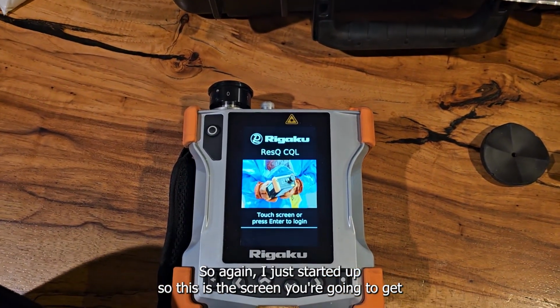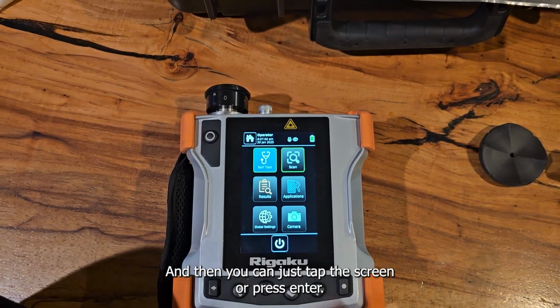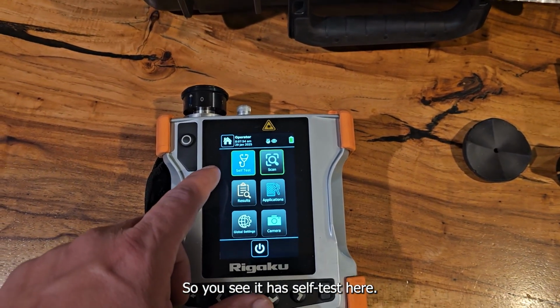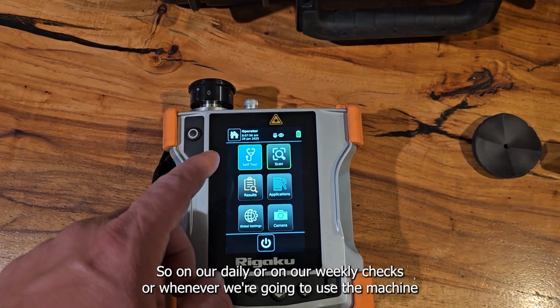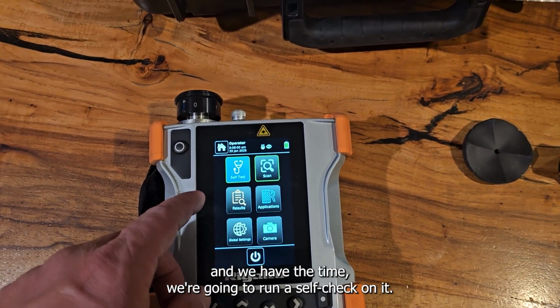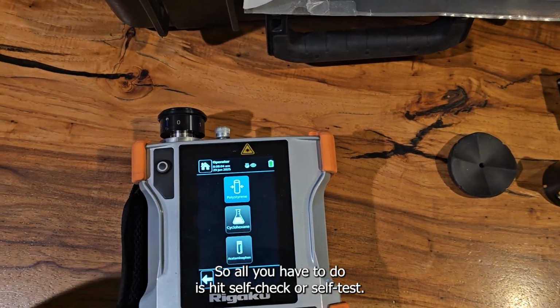So again, I just started it up. This is the screen you're going to get when you start it up, and then you can just tap the screen or press enter. So this takes us to our start screen. You see it has a self-test here. On our daily or weekly checks, or whenever we're going to use the machine and we have the time, we're going to run a self-check on it. All you have to do is hit self-check or self-test.